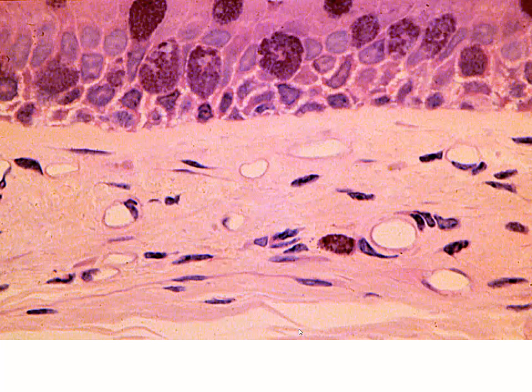And another image, slightly different contrasting picture to help us be able to look at these. You can see our respiratory mucosa, certainly, our fibroblasts running throughout this tissue. So this is our dense, irregular connective tissue just beneath the epithelium.